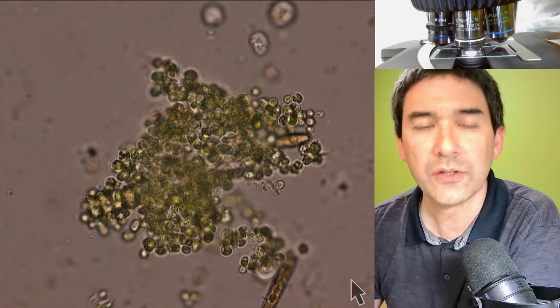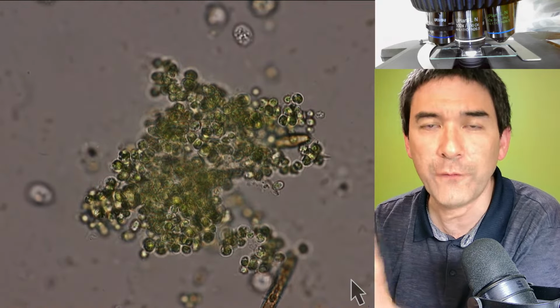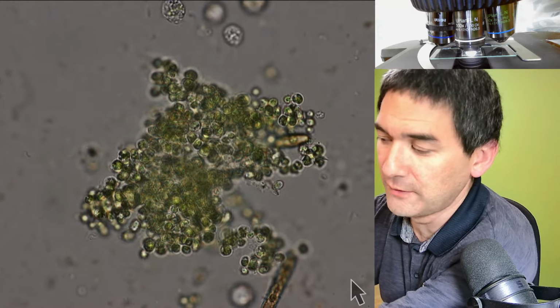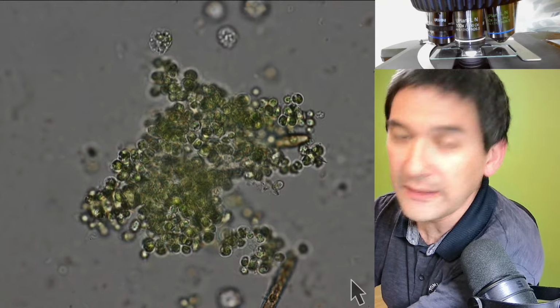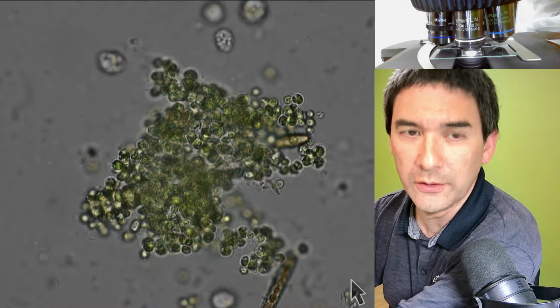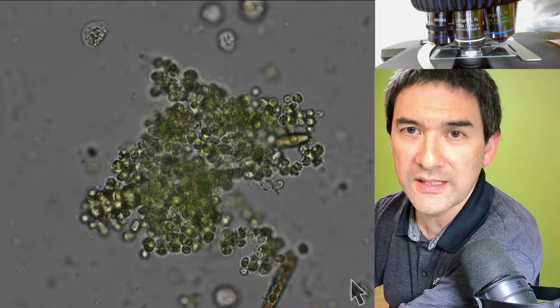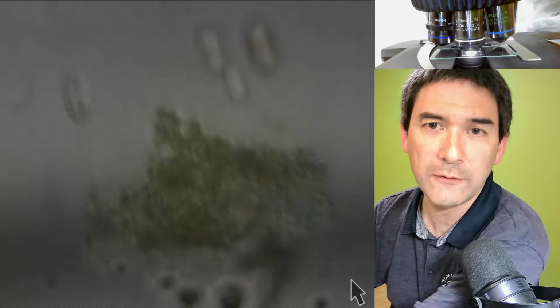So this is basically the time when I'm going to engage the focus lock lever, which I just showed you before. Everything is in focus. I pull the lever forward, which you cannot see. Now what I can do is lower the stage with my coarse focus, and when I go up all the way and let go, then I'm again back in focus.